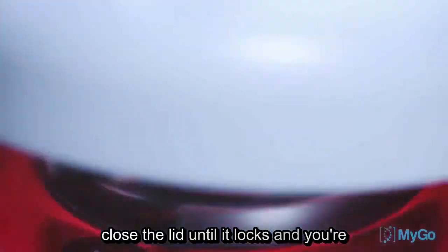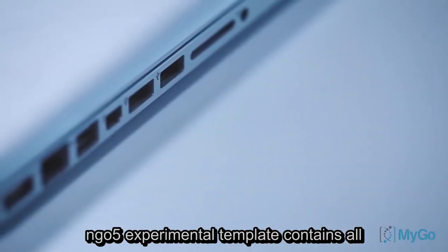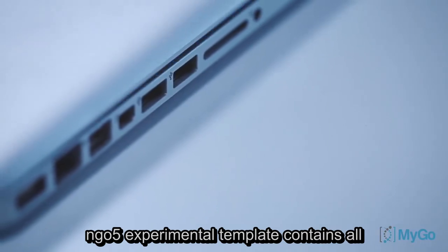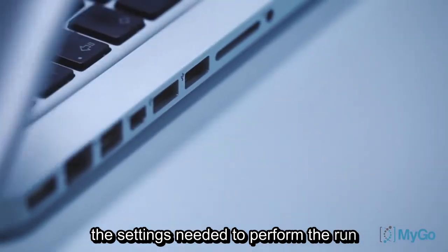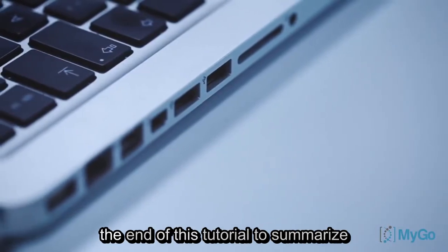Close the lid until it locks, and you're ready to begin your experiment. The MYGO 5 experimental template contains all the settings needed to perform the run, and can be downloaded from the link at the end of this tutorial.